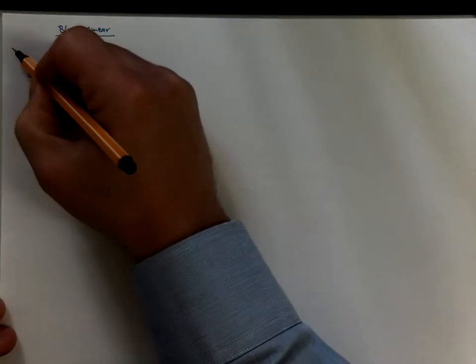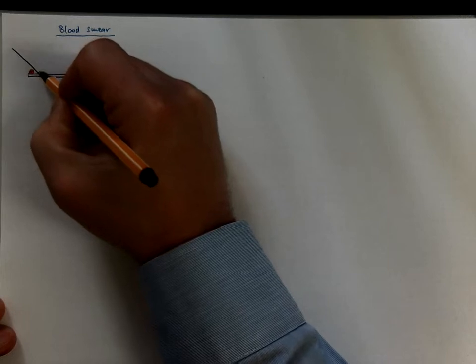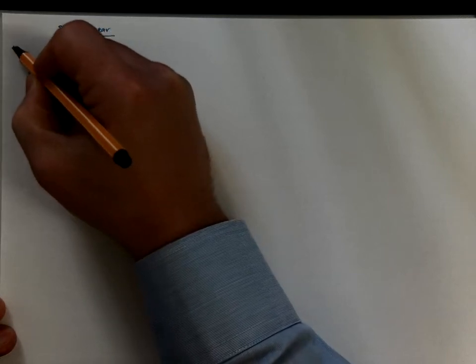You will apply 1 droplet of blood on the edge. You will touch it with a 2nd histological slide.